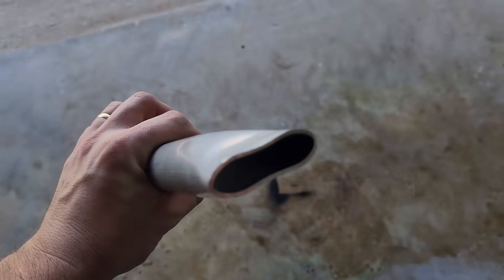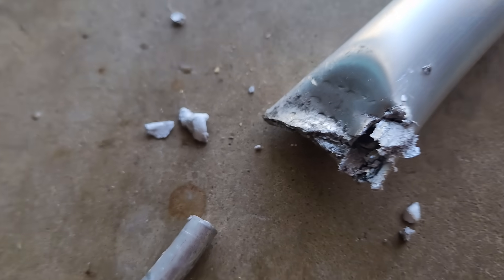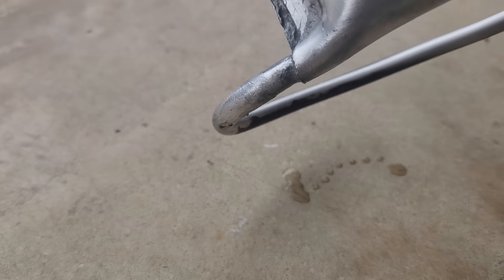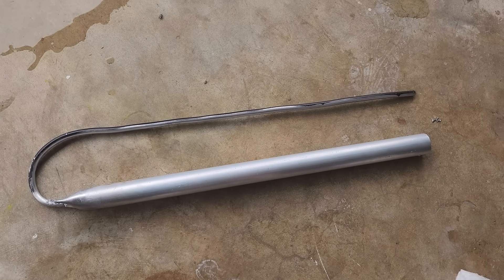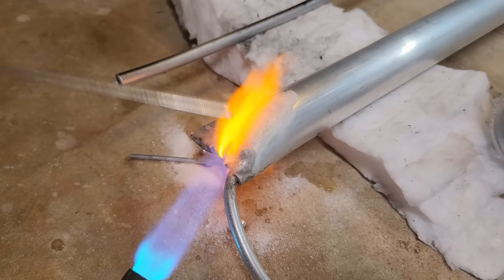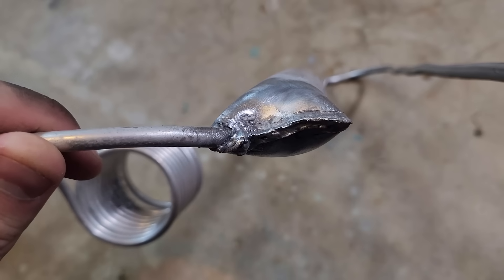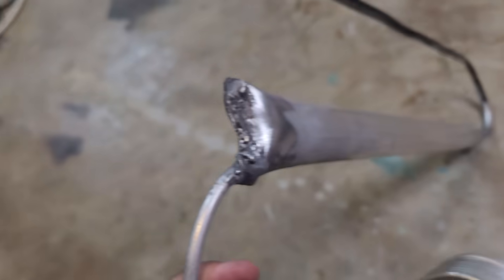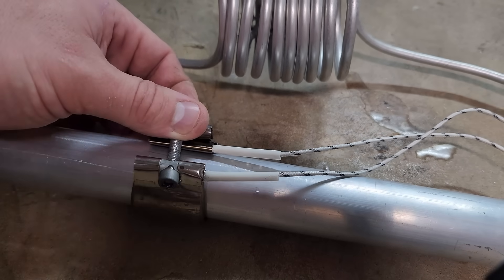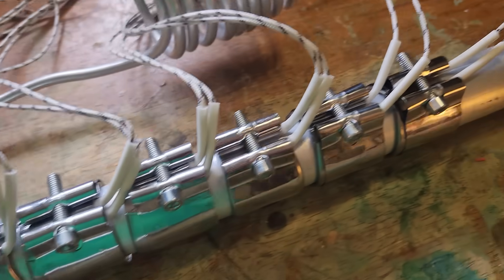Now let's build it. I start by squishing the end of a 1 and 3/8 by 24-inch long aluminum pipe so I can braze a feed tube onto it. Brazing aluminum is way harder than brazing copper — that was a total disaster. Let's try again with flux, actually a lot of flux. Pretty ugly, but it's holding a column of water so it seems sealed. I fill the open end with aluminum oxide beads, then reuse the aftercooler coil from my previous ethylene generator and braze it on the same way. Here's one of the band heaters — 35 mm inner diameter, fits almost perfectly over the 1 and 3/8 inch pipe. I'm adding 8 total, each providing up to 135 watts, so just over a kilowatt total.